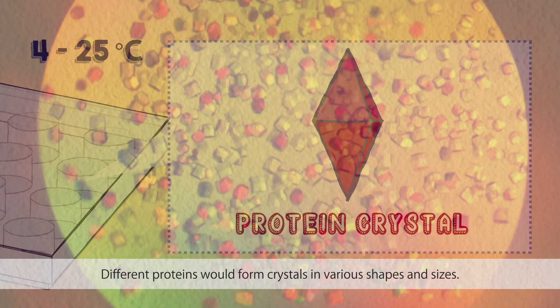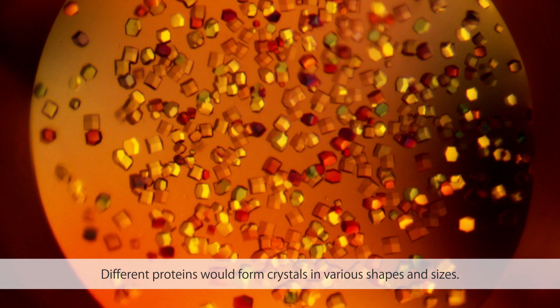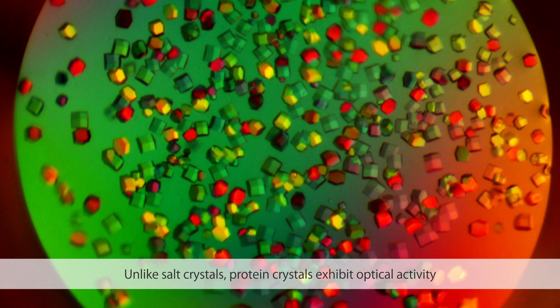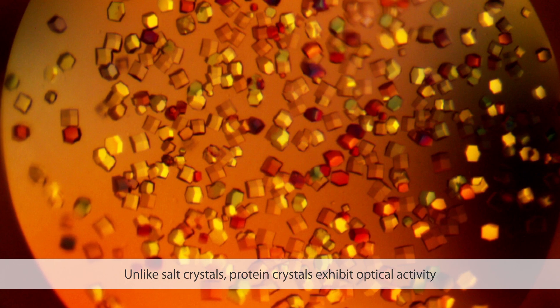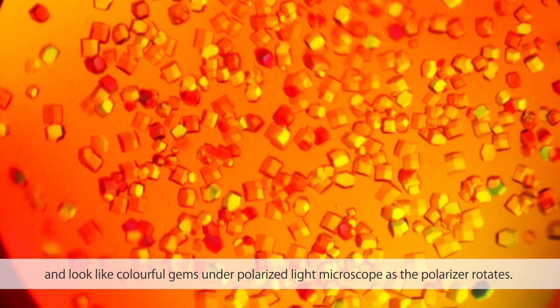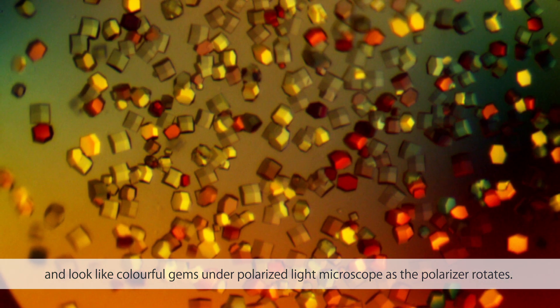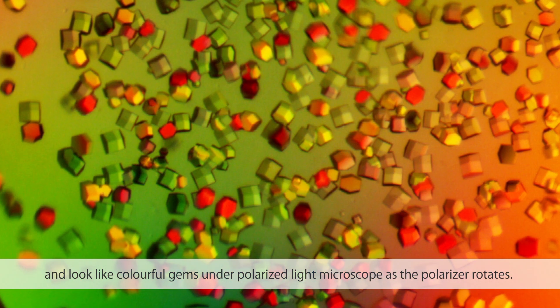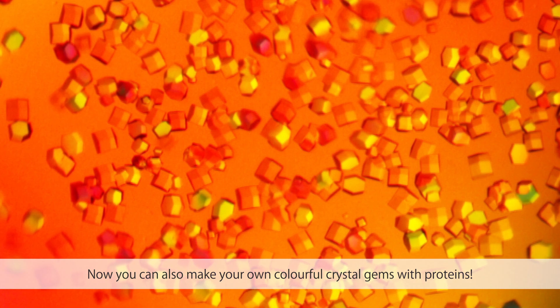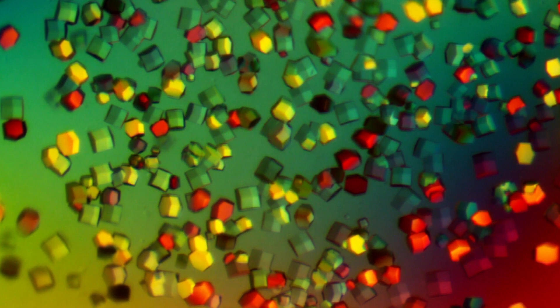Different proteins would form crystals in various shapes and sizes. Unlike salt crystals, protein crystals exhibit optical activity and look like colorful gems under a polarized light microscope as the polarizer rotates. Now you can also make your own colorful crystal gems with proteins. Thank you!